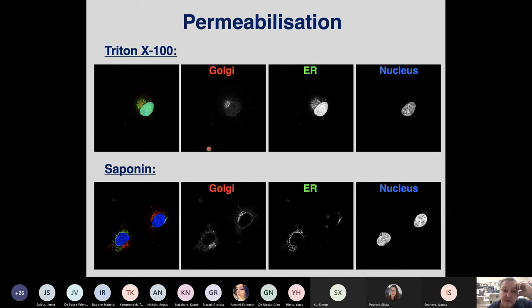So I've used, this is just boring COS cells, but for this purpose they were good enough. And I've used an antibody in red that recognizes the Golgi apparatus, and an antibody in green that recognizes the endoplasmic reticulum. And when I do Triton permeabilisation, the Golgi signal is okay. So it's on one side of the nucleus, I'm not too worried about this one. But what I'm a bit concerned about is this ER signal.